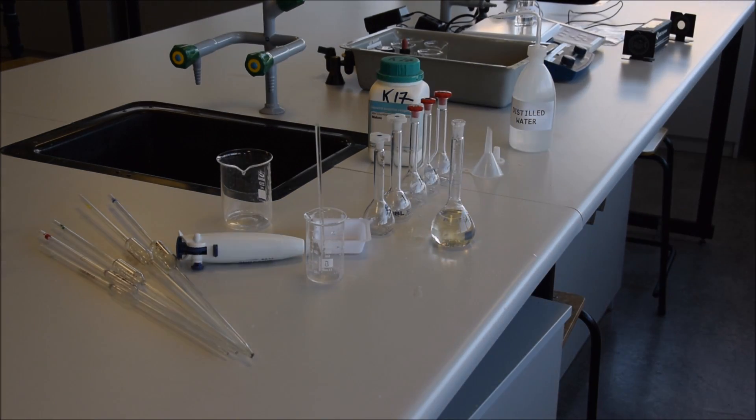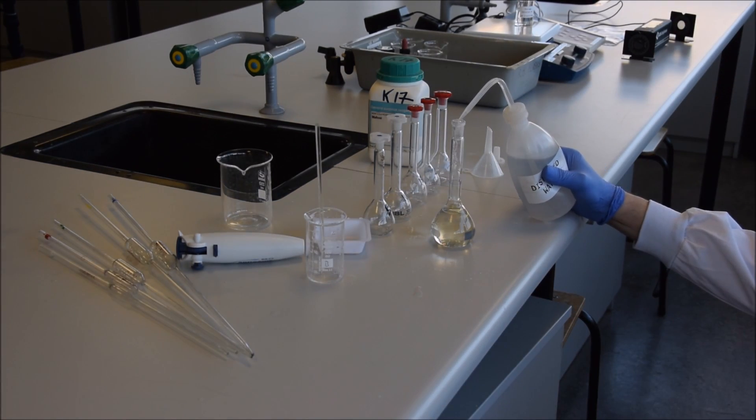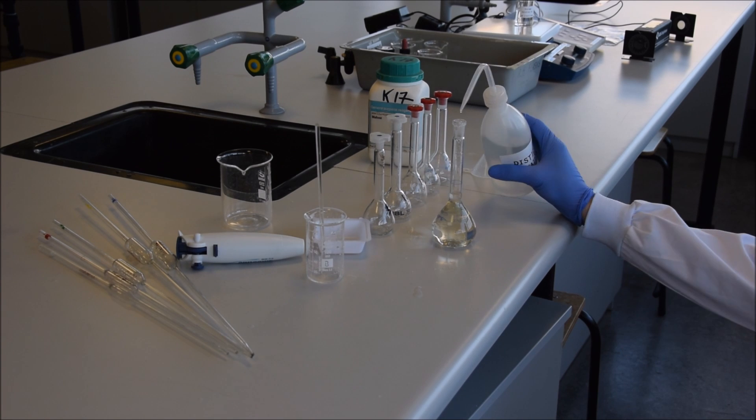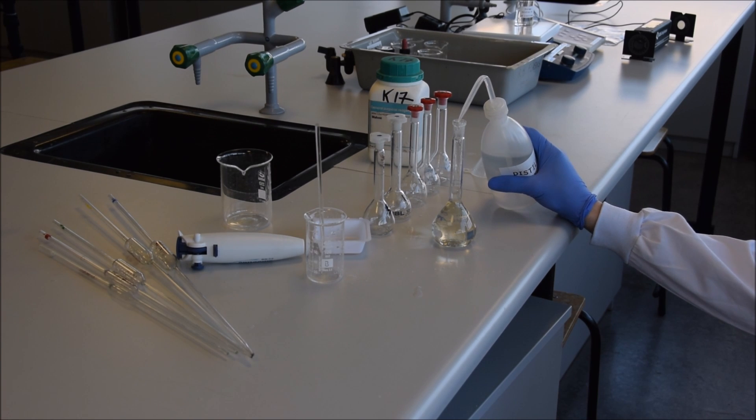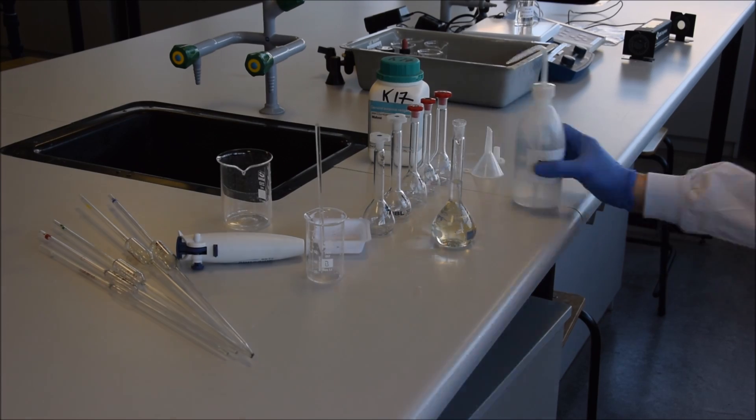Once I've made it up to the line, it's important to be patient here because if you get it wrong, you've got to start again. Get it up to the line, put a lid in and make sure it's homogenous.